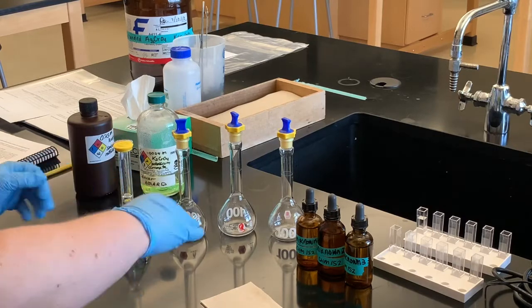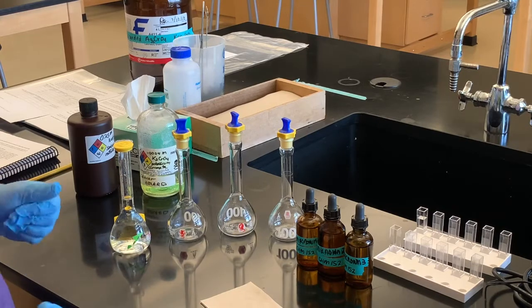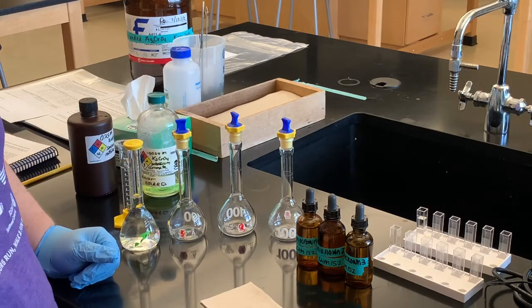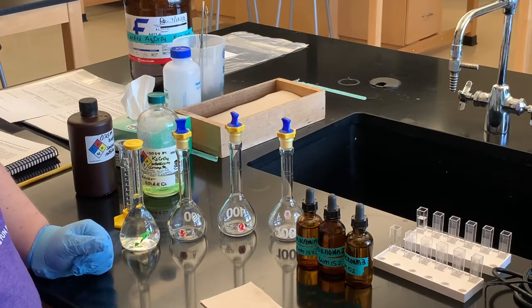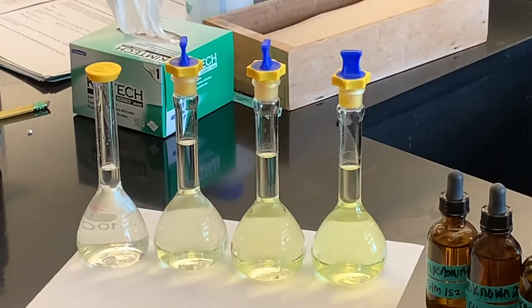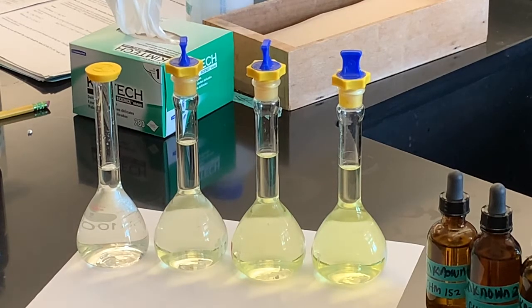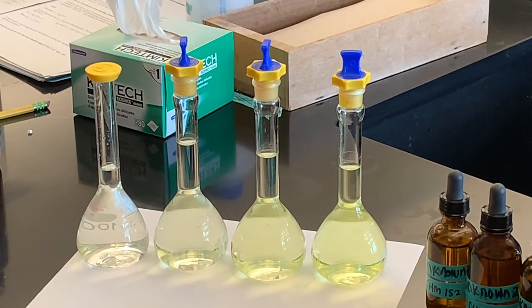You'll see when all the solutions are made that the more concentrated the solution, the darker that yellow color will be. As you go up in concentration — from one milliliter of potassium chromate up to fifteen milliliters — the yellow becomes brighter and darker.